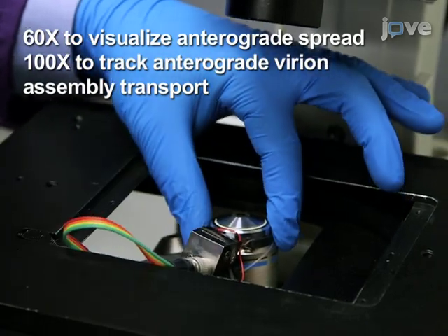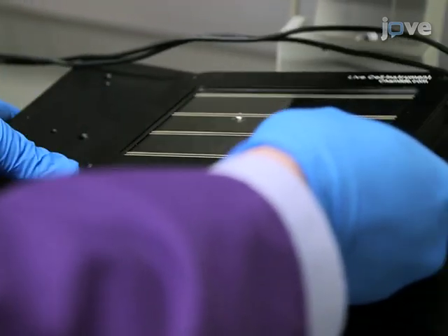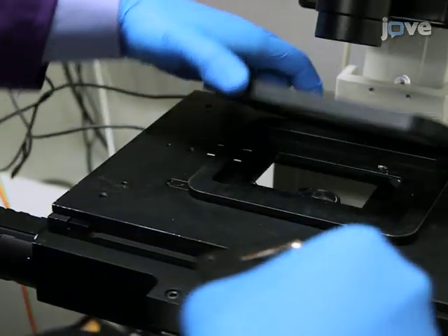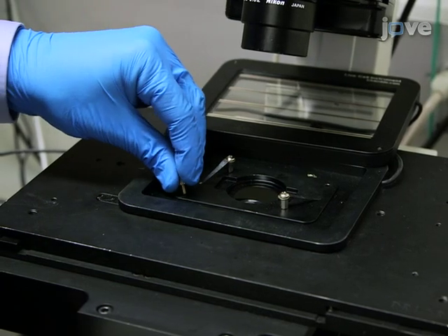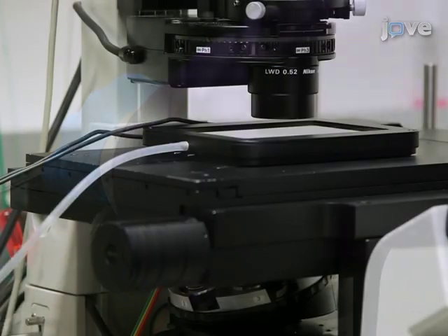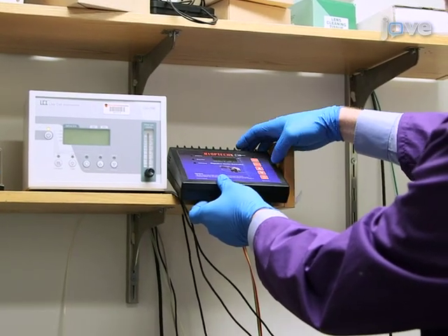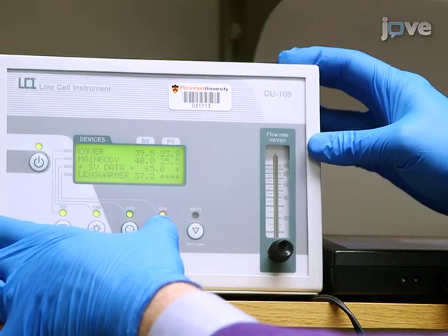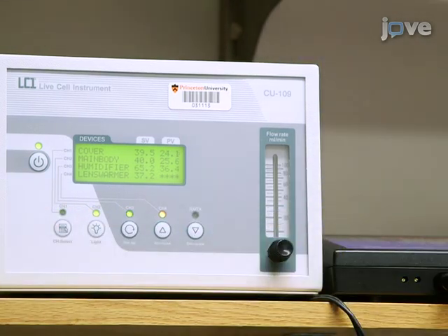Next, attach a lens warmer to the appropriate oil immersion objective, and then attach the stage-top incubator to the motorized stage of the microscope. Ensure that the appropriate insert that will hold the sample is in place, and then attach the humidified air line from the incubator control to the input port on the stage-top incubator. Turn on the incubator and lens warmer controls, and then adjust the temperature settings to the previously verified conditions specific for the objective and sample being imaged.